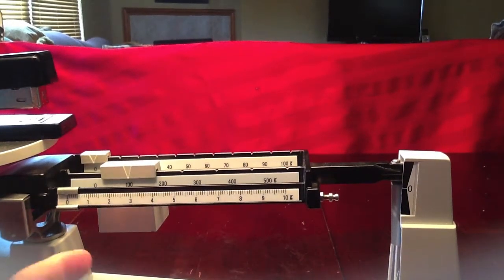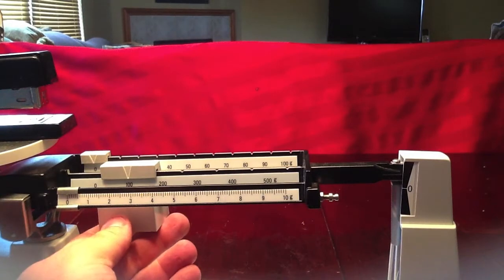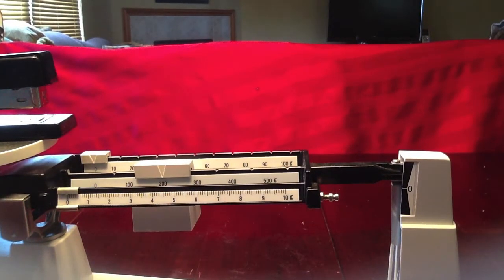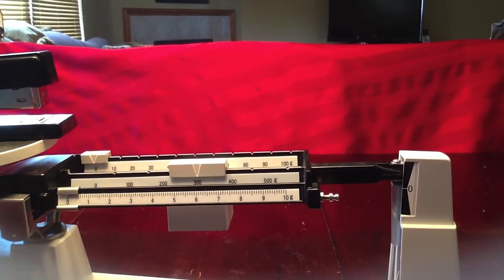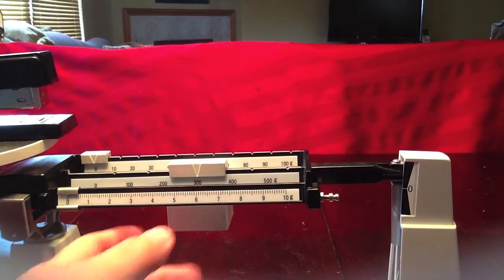We want to make sure that the arrow on the rider lines up with the number on the scale. We are currently up to 300 grams and have not fallen below zero.